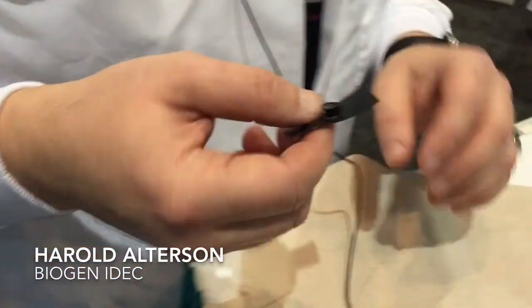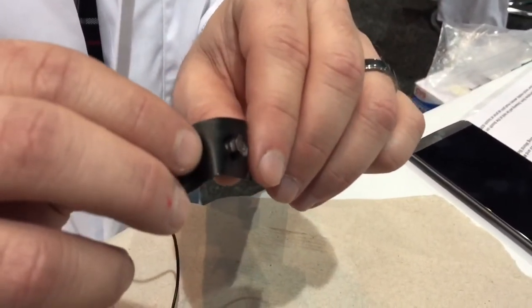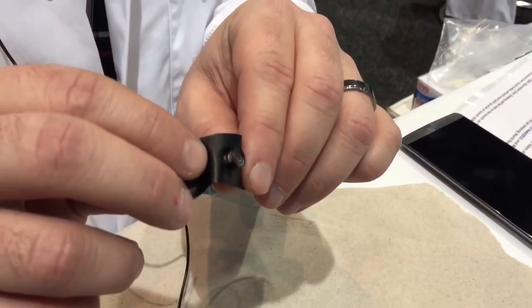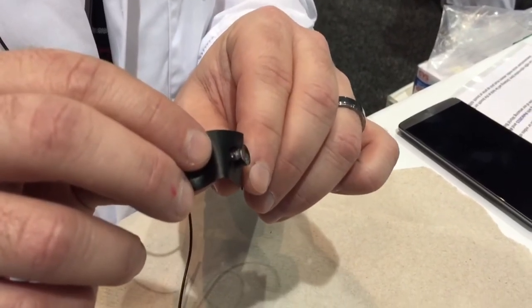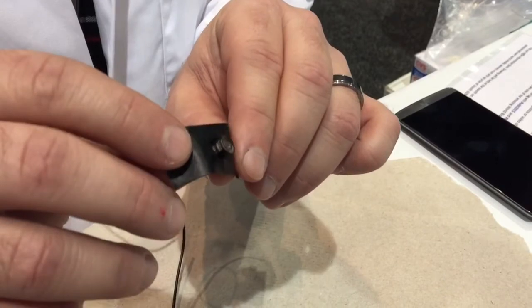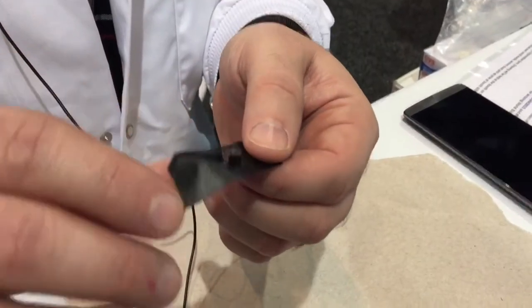What do you got in your hand there? So in my hand I have a lens that is made from basically two laser pointers. They were disassembled and the little plastic cap was pulled out. And we just taped them together and we'll go ahead and tape it over the lens of your cell phone camera. And we'll make it into a microscope.